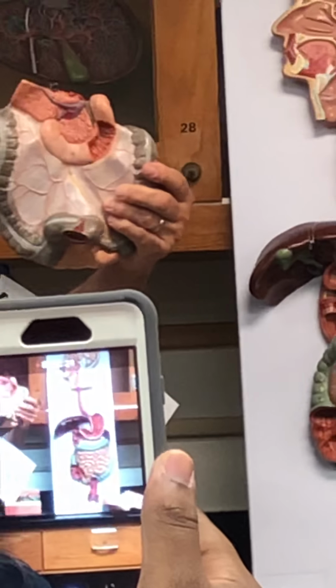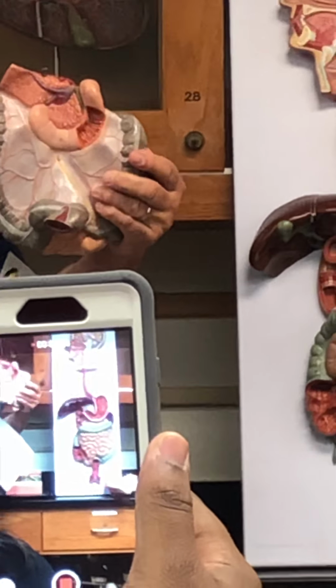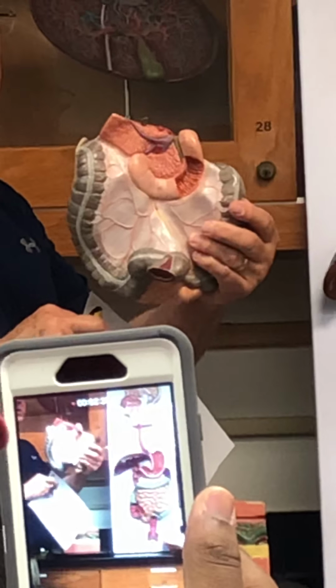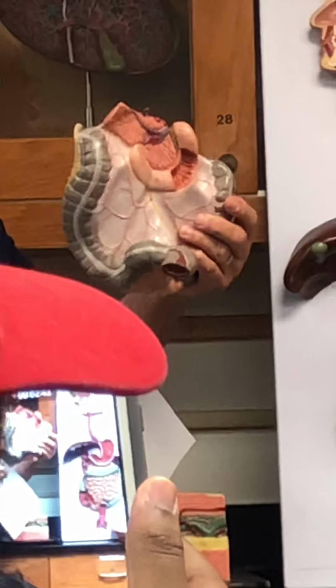See that gray material on the other side? That's another mesentery. What's that called? Lesser. Is it the lesser omentum? Meso. Right, meso, it's called a mesocolon or mesentery. Additional structures that allow for the ability for these organs to stick together a little better.